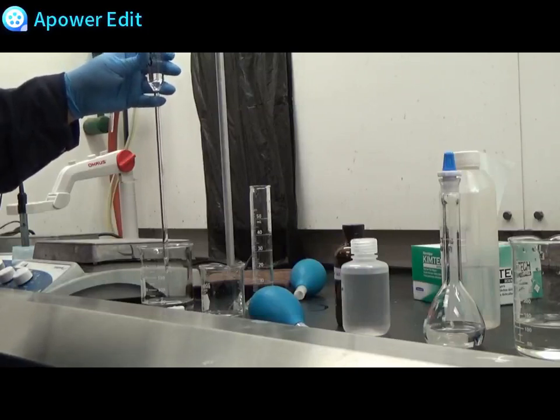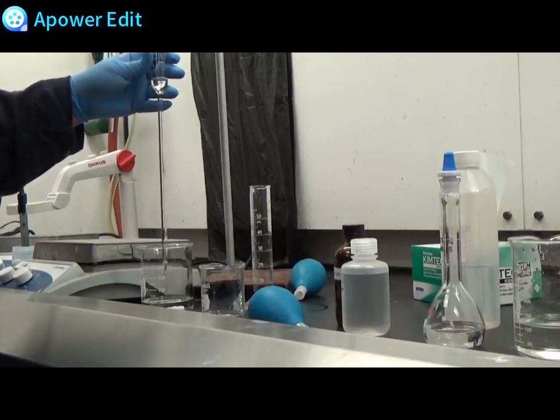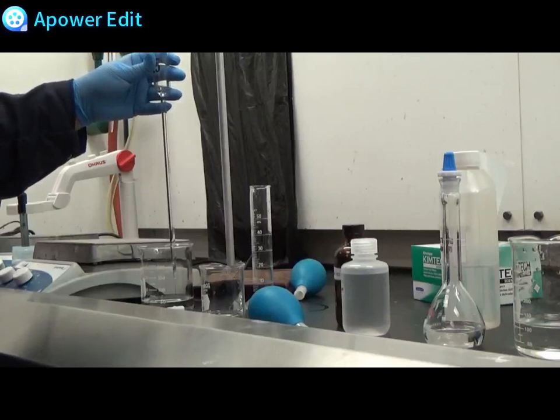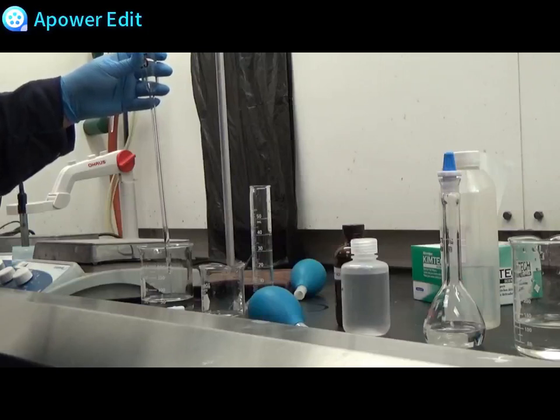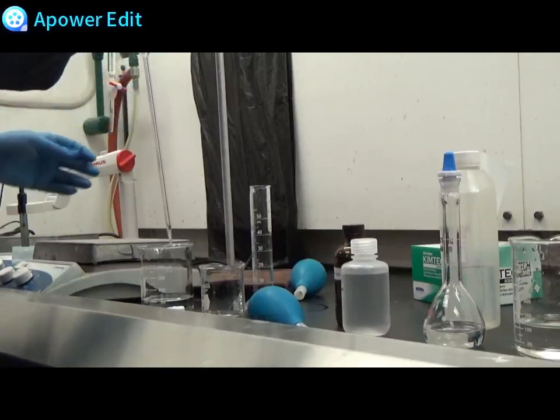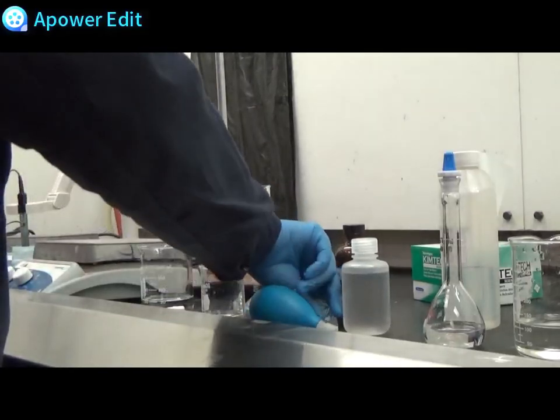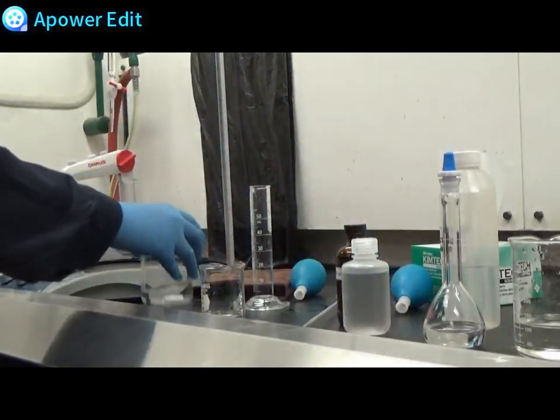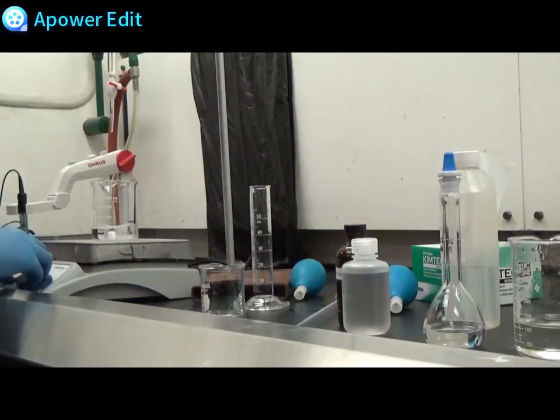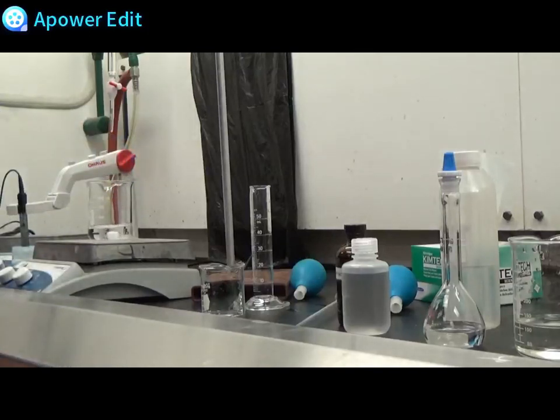Luckily this acid is very mild, however always remember to add acid to water, never add water to acid. Do not worry about the last drops that are caught in there. The manufacturer has already accounted for that volume that will be left behind. The pipette is calibrated to deliver.